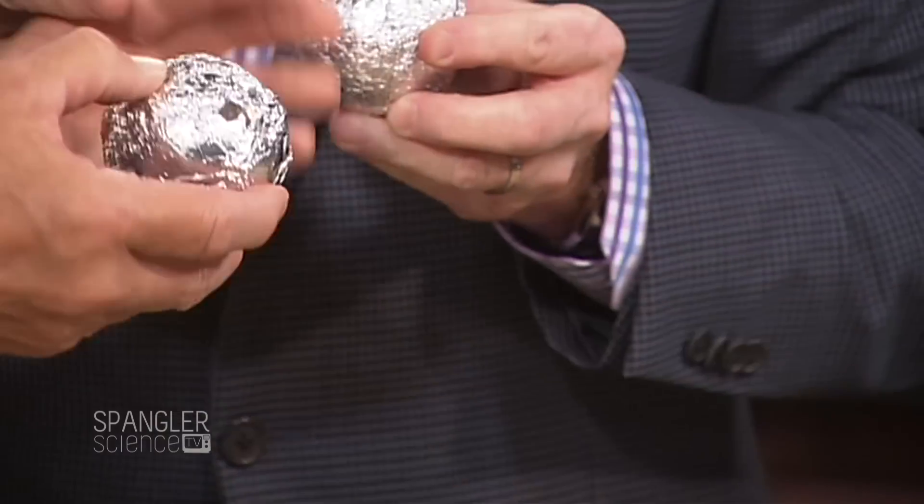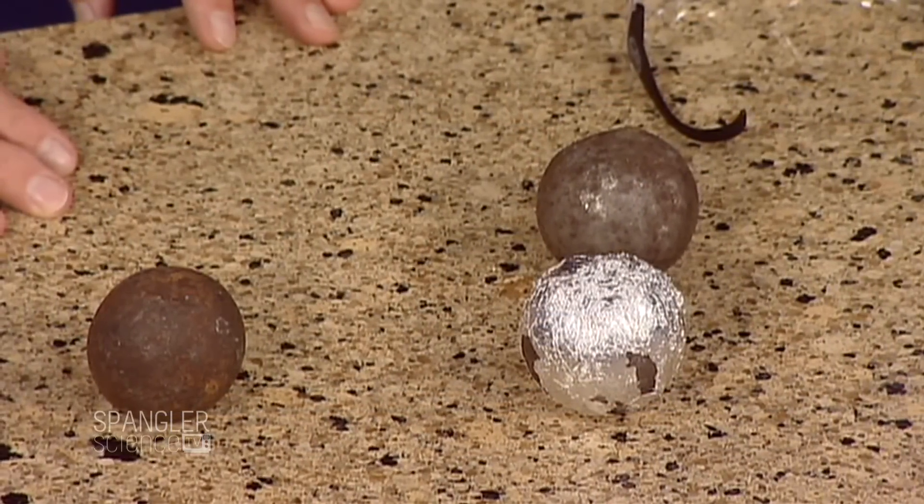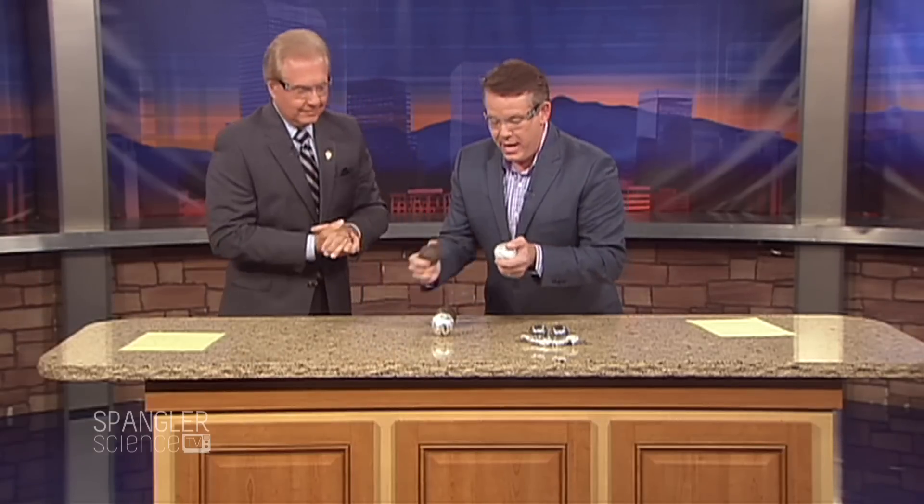This is much, much safer than the thermite reaction you would use in a classroom. What was it like — molten iron that went through? It went through and into a bucket of sand, but unfortunately leaked out of the bucket of sand like lava. Are we going to SteveSpangler.com or Steve Spangler Science? Go to SteveSpanglerScience.com for this one, because it is such a hot experiment.